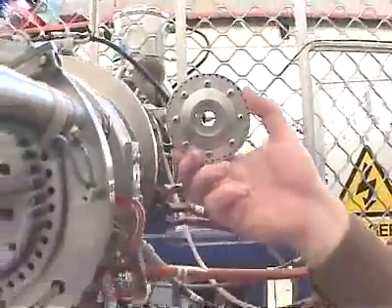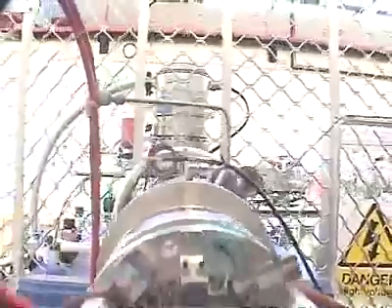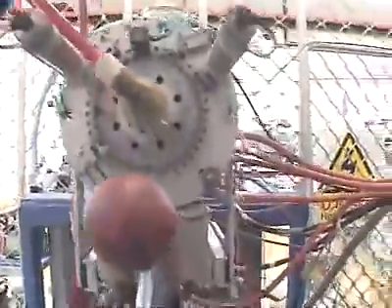The purpose of the ion source is to pull the carbon atoms out of the graphite and fire them down the tube towards the accelerator like bullets out of a gun. In order to get them pushing fast enough to get to the accelerator, we put a very high voltage onto this ion source, 50,000 volts. That's why the source is enclosed by a cage. There are doors which we lock when we're running so that nobody can get in here and injure themselves.